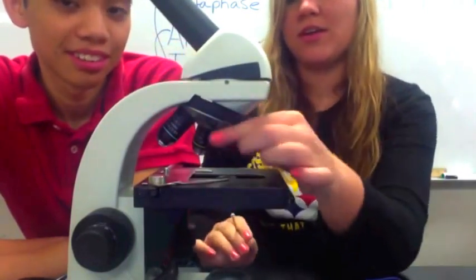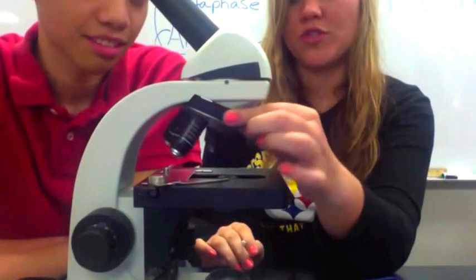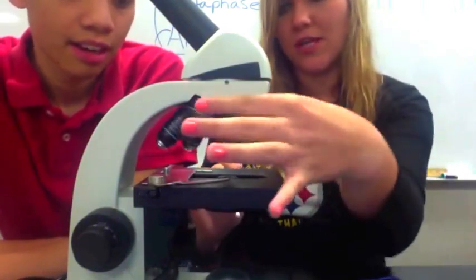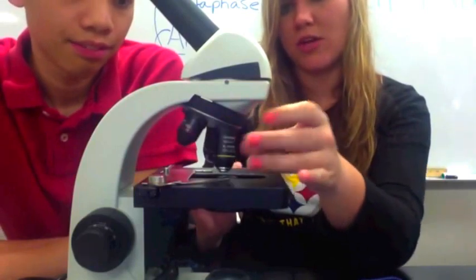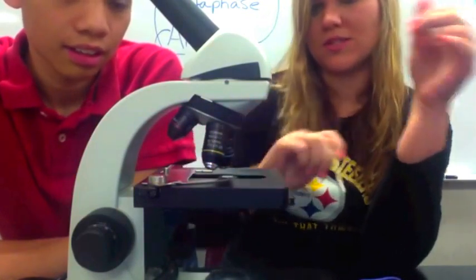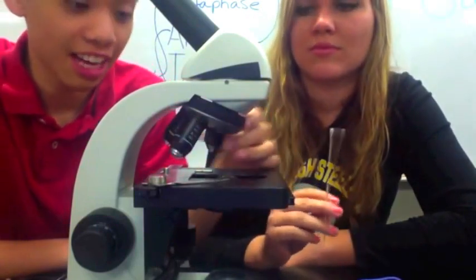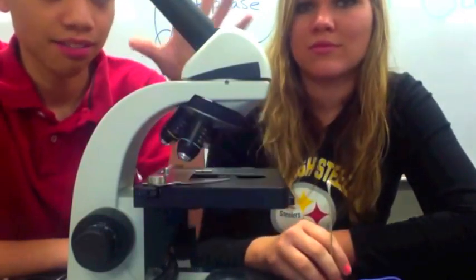This part down here is called the rotating nosepiece. This is what moves your objective lenses into place. On this particular microscope you have three objective lenses, and each objective lens has a specific magnification so you can see the specimen in different views.